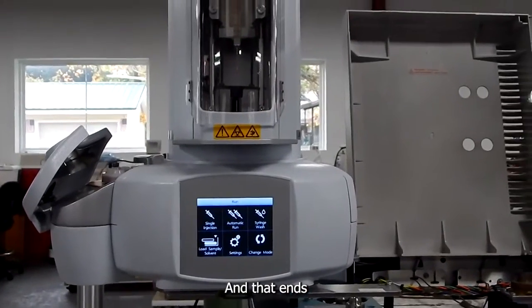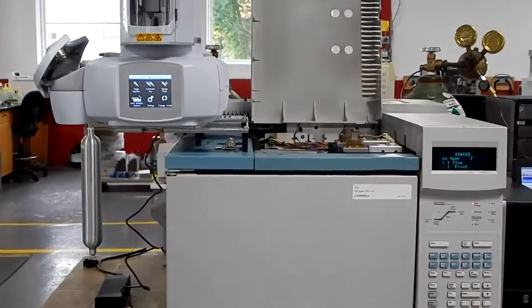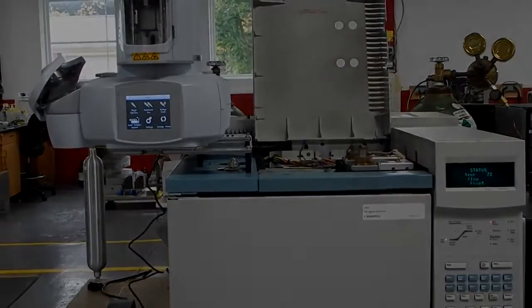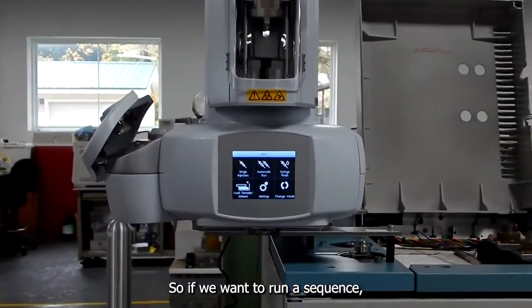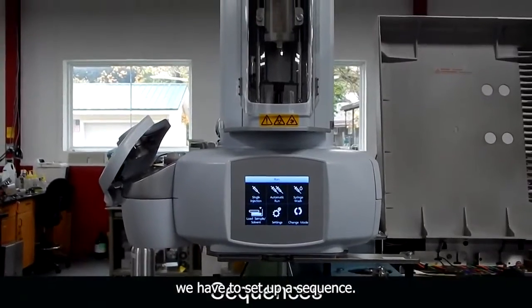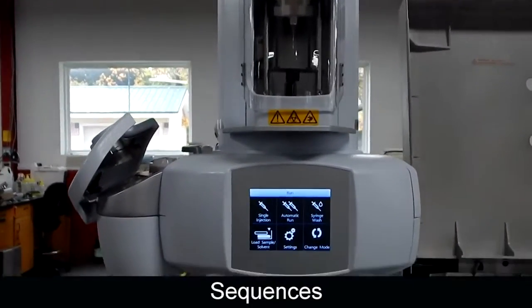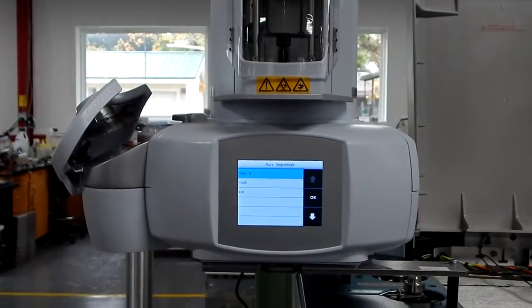That ends the single injection. So if we want to run a sequence, we have to set up a sequence. So from the run page, go to settings, and then sequences.